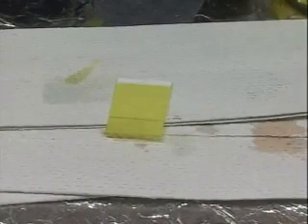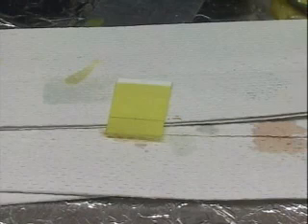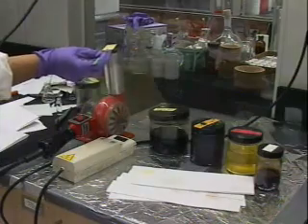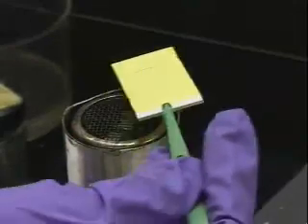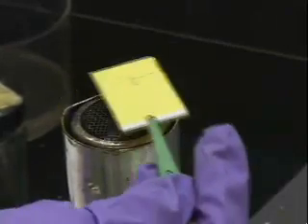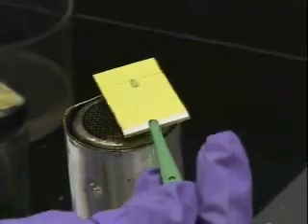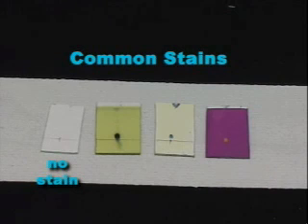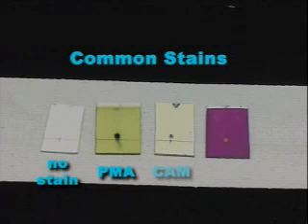Don't be discouraged if you don't see any spots on your plate just yet. You have to heat the plate to activate the stain. Turn on the heat gun and hold the plate just above the barrel. Watch closely and you should see your spots appear. Don't heat for too long or you'll end up with a blackened TLC plate. While numerous TLC stains have been developed, some good common ones are phosphomolybdic acid, PMA, ceric ammonium molybdate, CAM, and potassium permanganate.